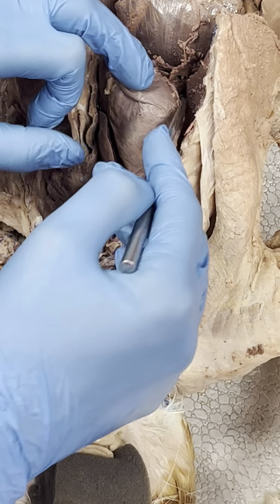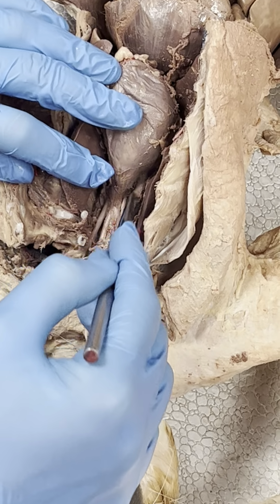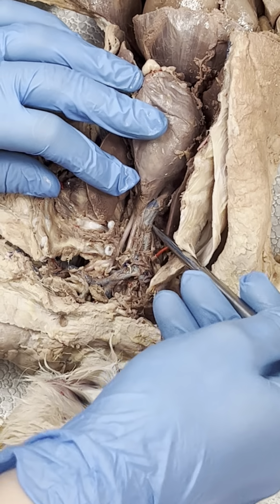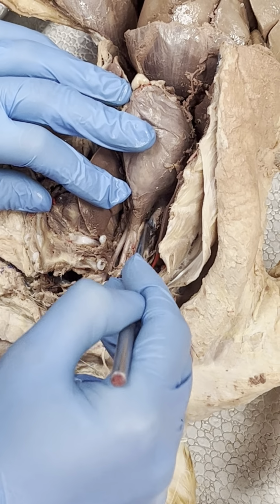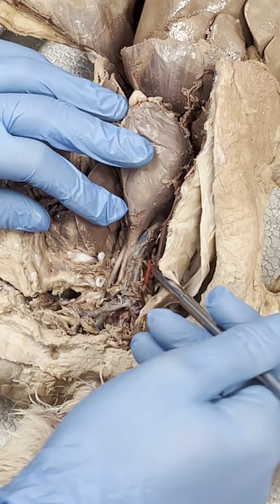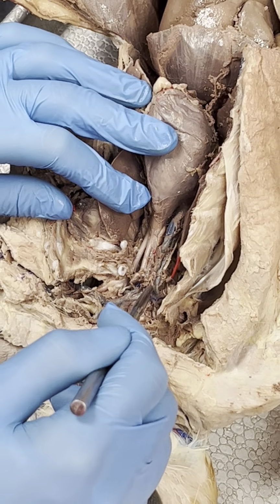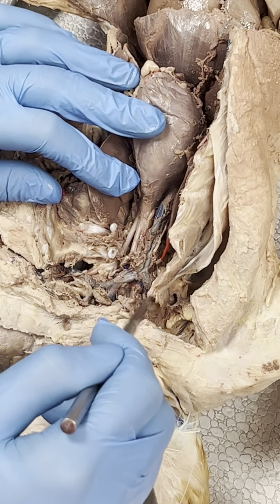For the venous system, I didn't really clear the back of the heart here, but you can see the superior or anterior vena cava here. It's this nice, really big, thick blue vein. And then you can see we've got some connective tissue here, so that's not a split, that's just where it is. All right, I think actually this is going to be the first split here. It's going to split into two brachiocephalic veins.